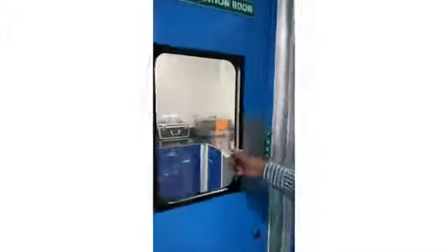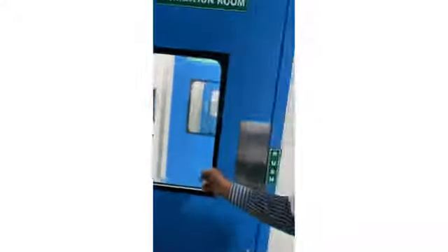Incubation room. In that room we have a deep freezer, an incubator for bacteria, and an incubator for yeast and mold separately. And also this is the instrumentation room. We have a microscope and also an air sampler, water double distillation unit, water bath and all. This is the decontamination room. Kill the organisms, and then we are washing area. Then exit.